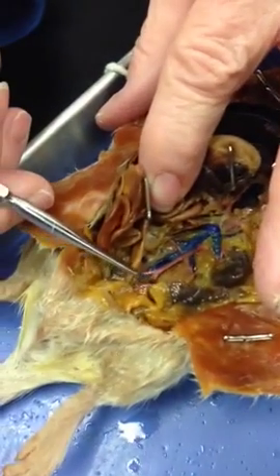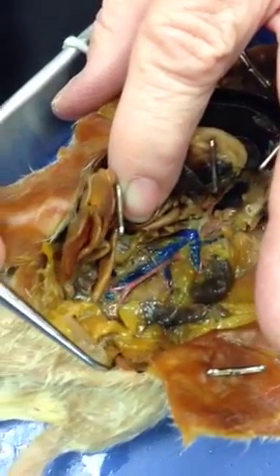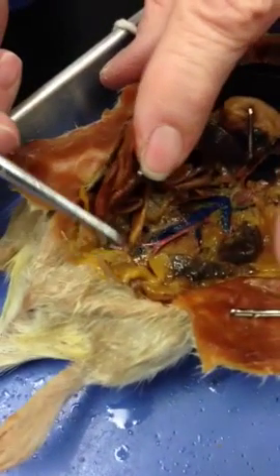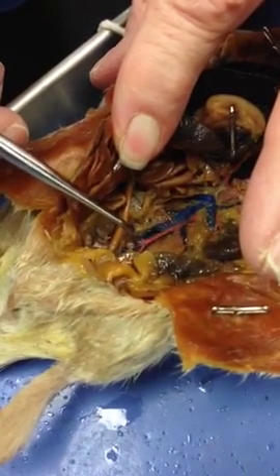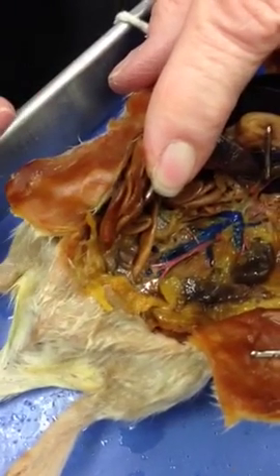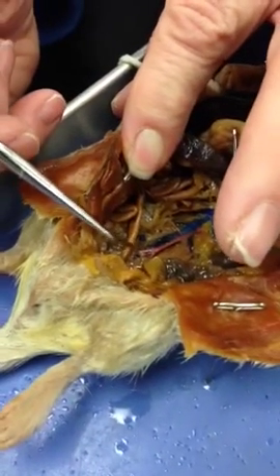These are the iliacs. Okay, those are the iliacs. And then they go on down into the leg and become femoral. Okay, so the iliacs turn into the femoral. Right. Okay. And this one that's right down the center, that's the caudal going to the tail, because they have a tail.